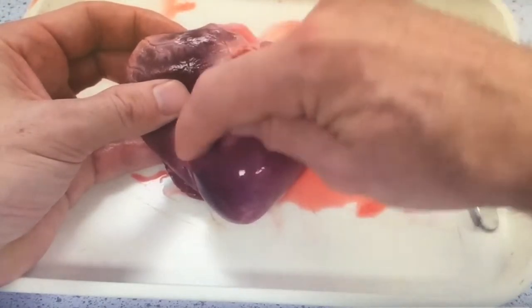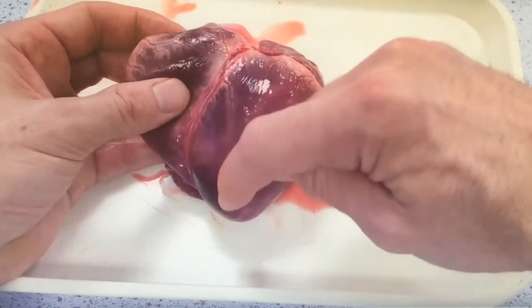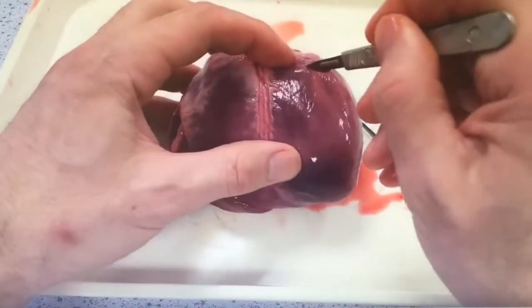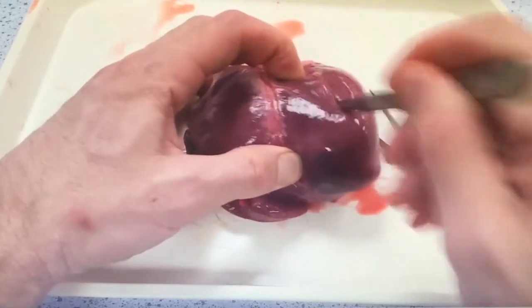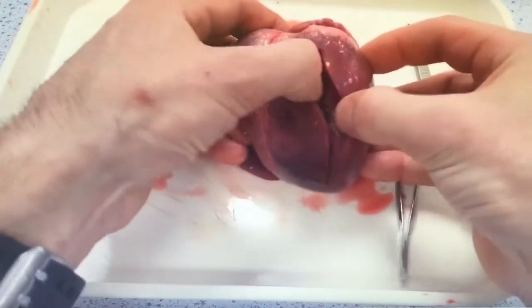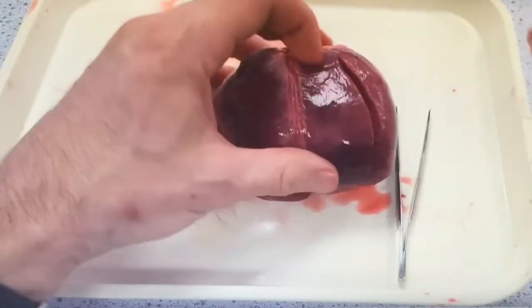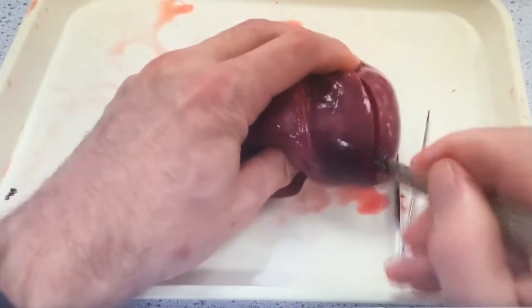Where will we make our first incision? We're going to work parallel to the coronary artery and that will take us straight down the centre of the left ventricle. You're going to have to cut quite deep and may take a couple of strokes with the scalpel. Your incision starts in the upper part of the ventricle and you work it down towards the apex.